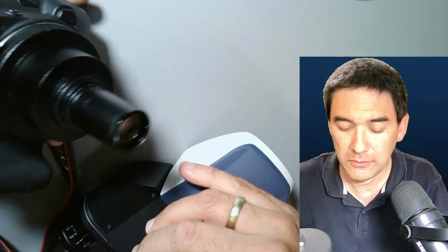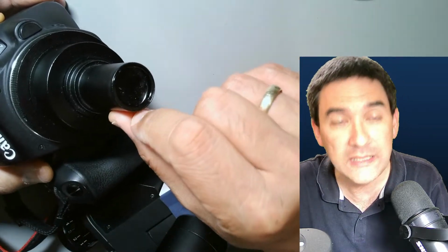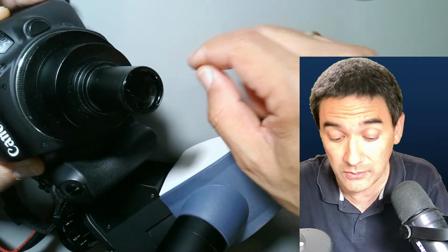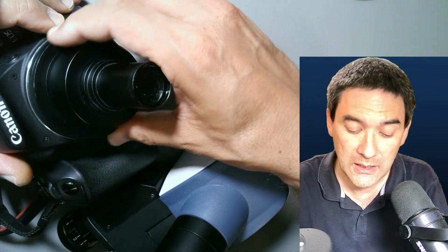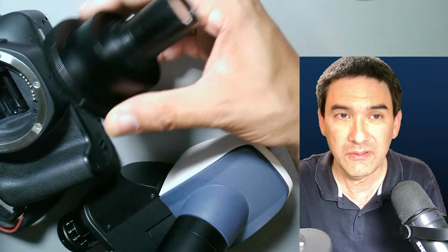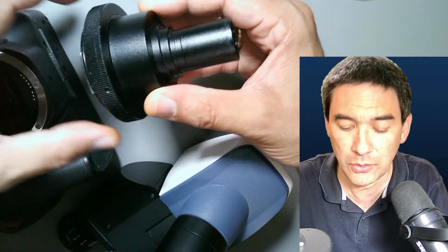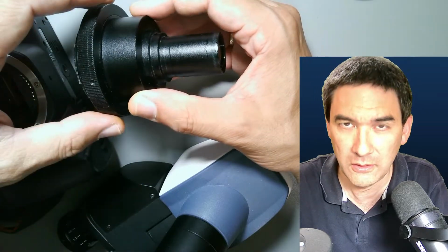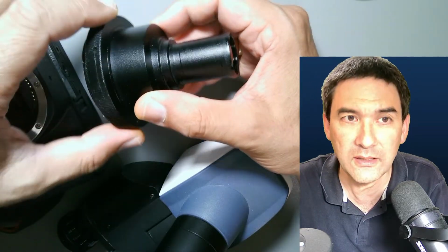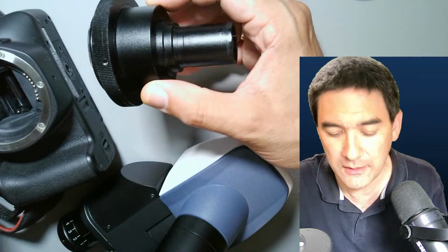Disadvantage number two, not a big one, but still, is that there are optics in between, and any optics that you have in between actually degrade the image quality to a certain extent. Okay, internal reflections and so on. And disadvantage number three is this adapter here. It's sometimes also not that cheap, not super expensive, but it's not the cheapest solution. So it's, I don't know, 150 euros or dollars, and then you have to get the camera-specific T2 adapter ring as well, okay? Not counting the camera itself, obviously, right?